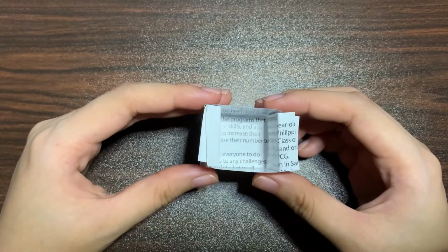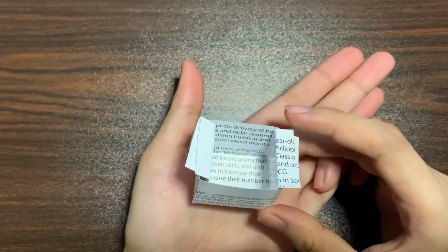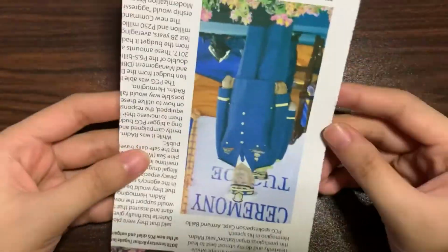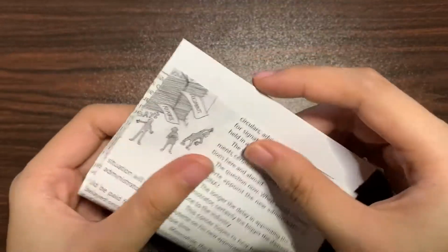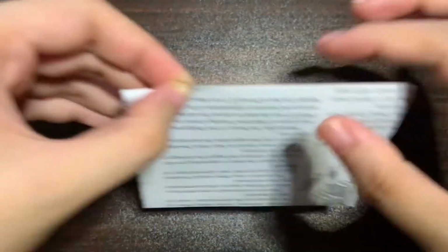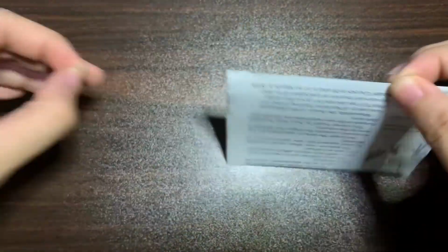Making a paper boat would be advantageous if tissue cassettes were not accessible in order to proceed with tissue processing. The only item required is a piece of glossy paper, such as the kind seen in magazines. You trim the page and cut it to the size of a 1/8 yellow sheet of paper.